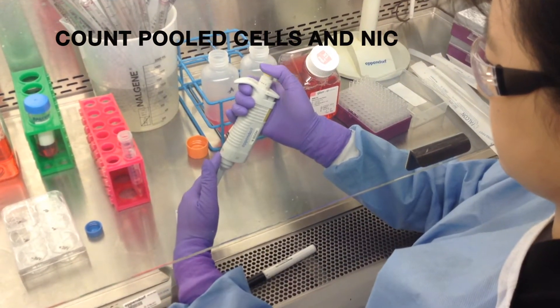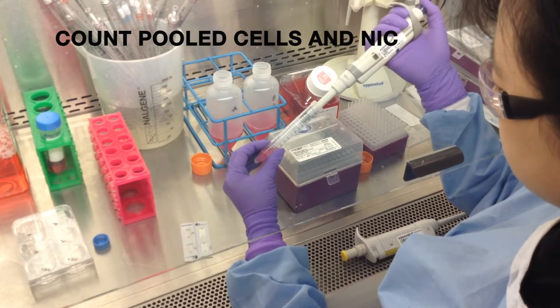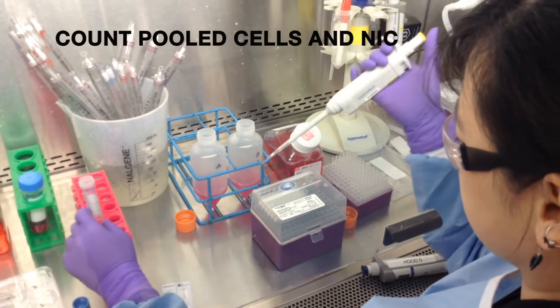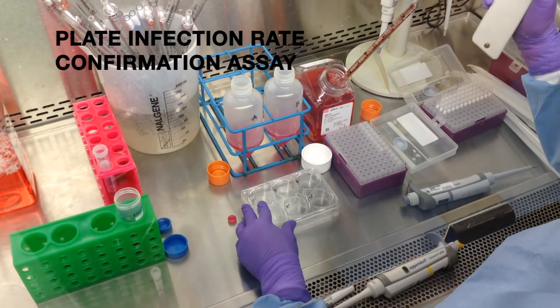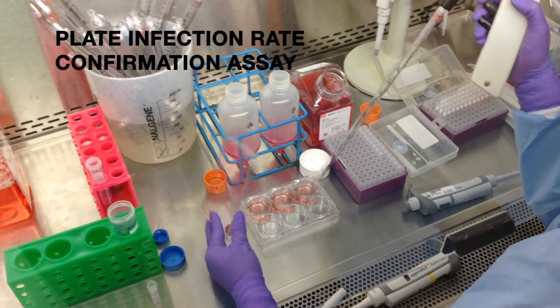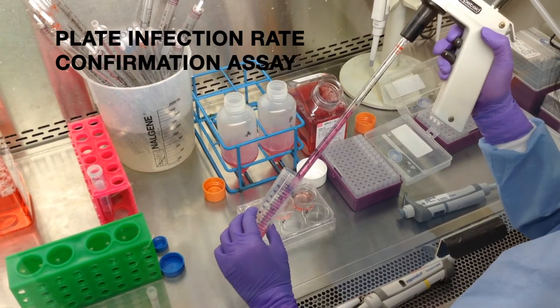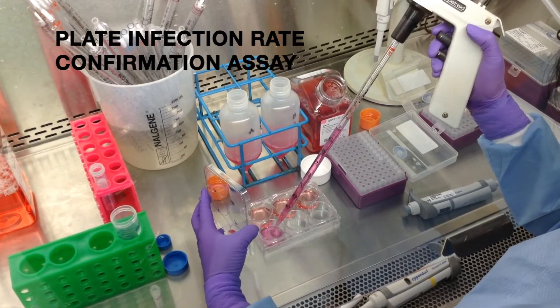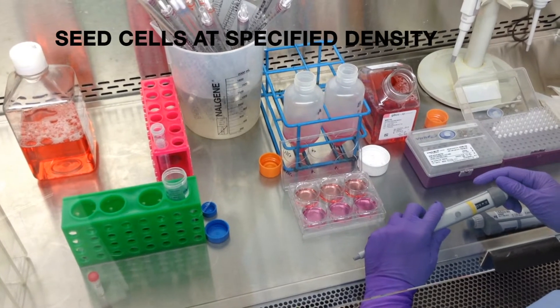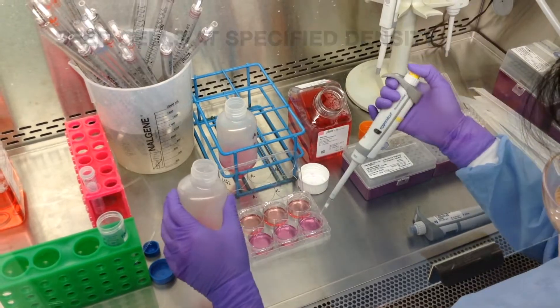Count the pooled cells for each replicate as well as the NIC well. Plate an infection rate confirmation assay with puromycin and no puromycin wells. Seed the cells into the plate at the density specified by the viral titration, including the NIC and the replicates.